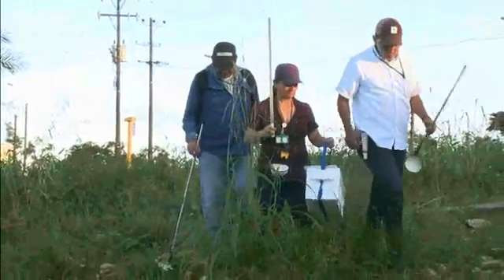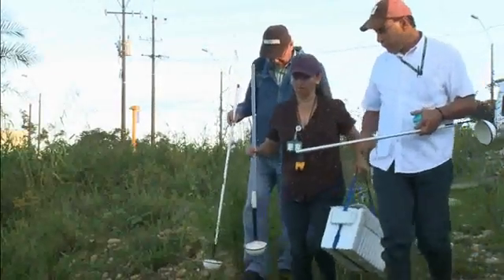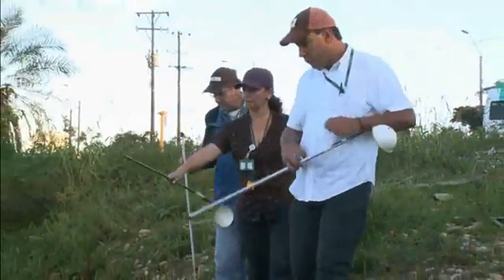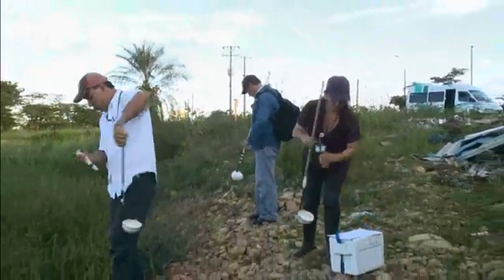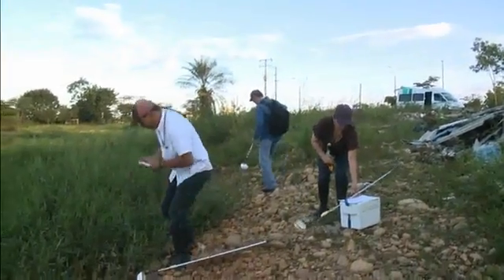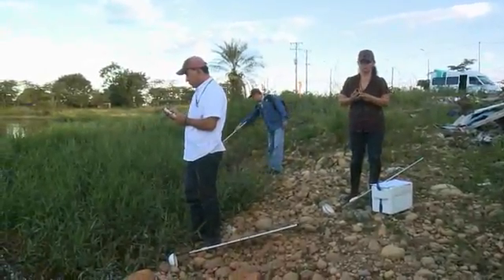When searching for mosquito larvae, it is necessary to proceed slowly and carefully. Approach the area to be inspected with caution to avoid disturbances that will cause the larvae to dive to the bottom. Approach the area to be sampled with the sun in one's face. This prevents shadows that also disturb larvae and cause them to dive.